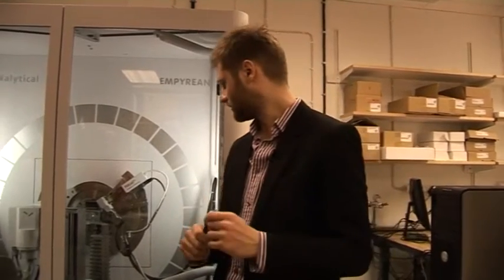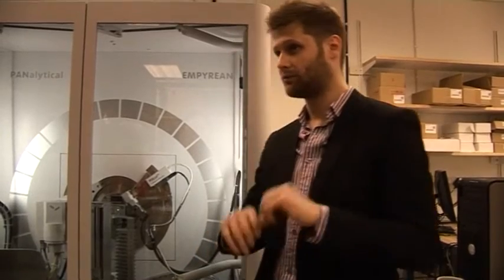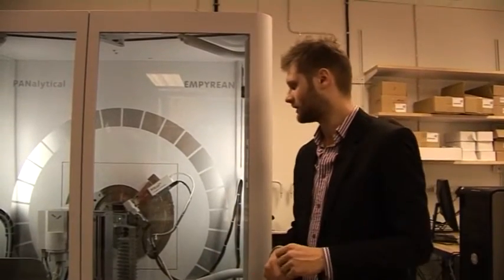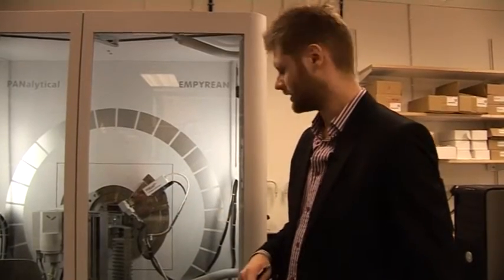My name is Daniel Kareltskin and I am a PhD student here at Chemical Technology. I will help you to look at this lab today and I think before we start any scan or run we just quickly have a look at the instrument itself.